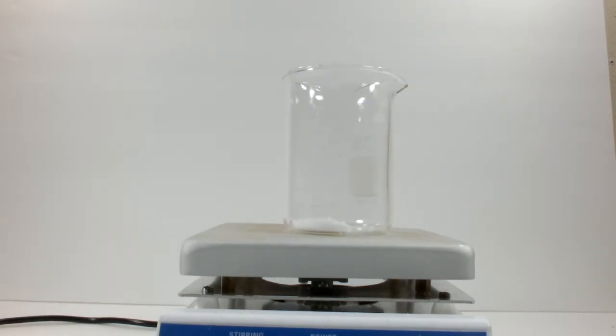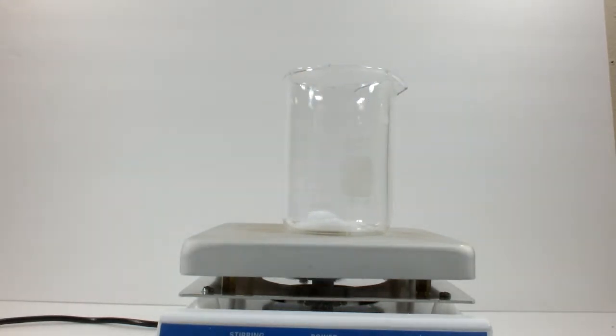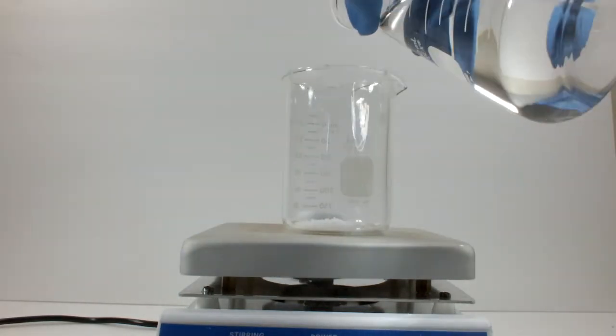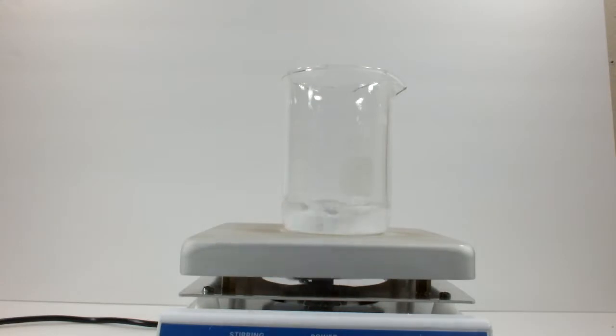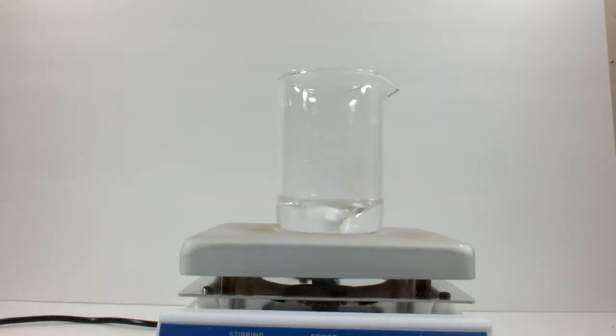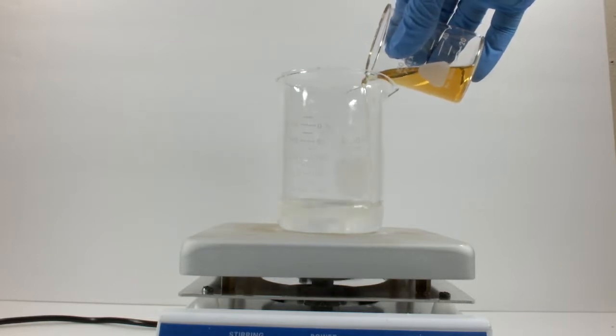Start with 2.4 grams of sodium hydroxide. Add a beefy stir bar, and then add some water to dissolve it. This is nowhere near enough water for the next step, so I'd recommend starting with about 200 milliliters. Next, add 16.9 grams of oleic acid.